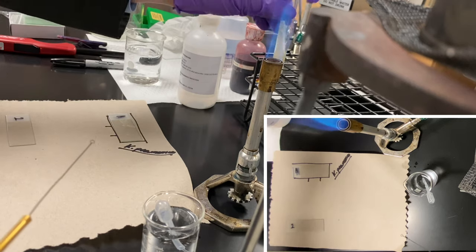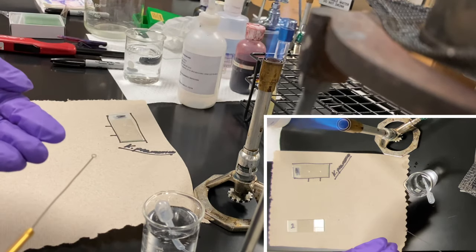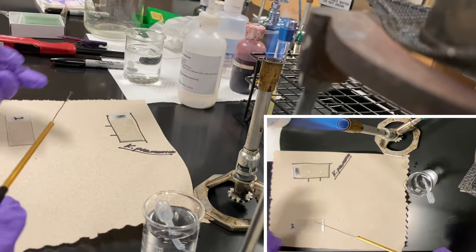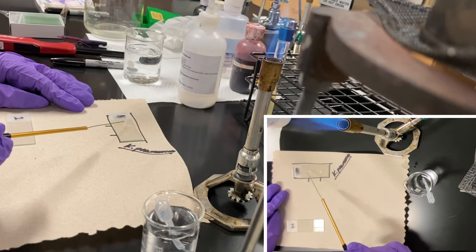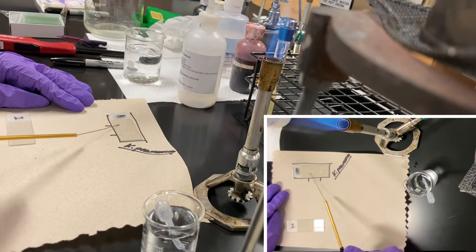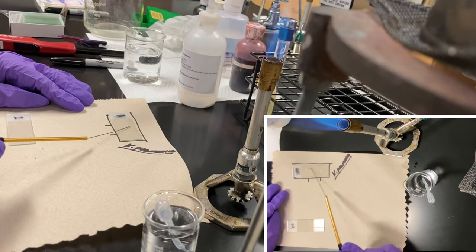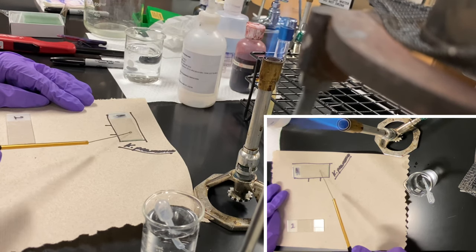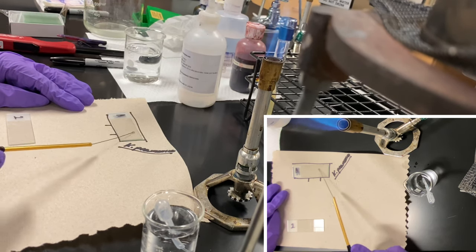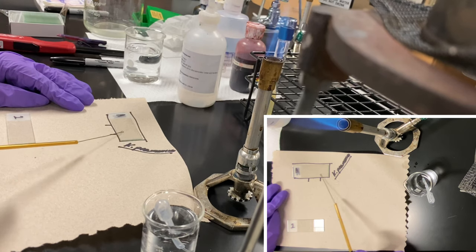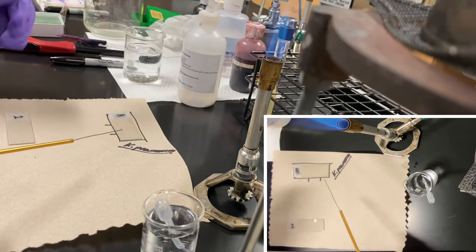Now I know for a fact I've got a couple million organisms sitting over here. I'm going to take it and smear it in large circles. I'm going to do the first one, the material is starting to dry out, and I'll do the second one. No breaks in between, just going from one to the other. Officially here I've created two large smears.